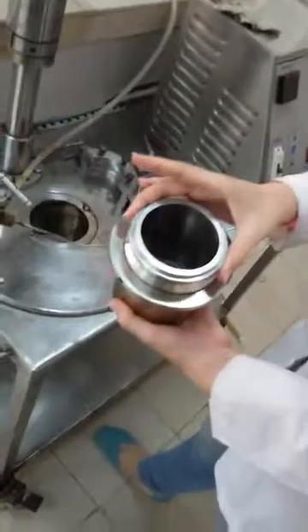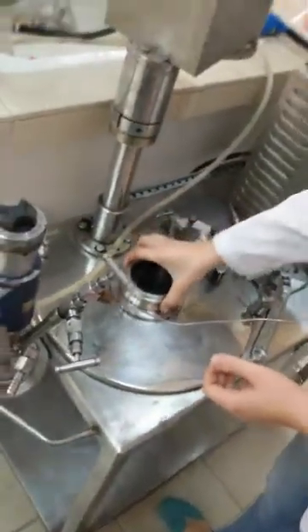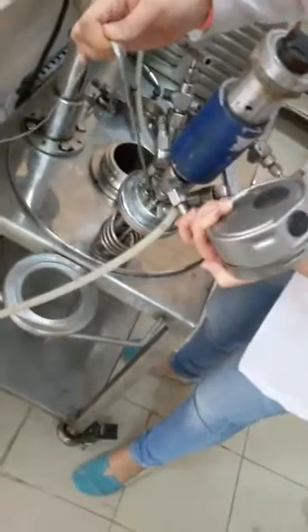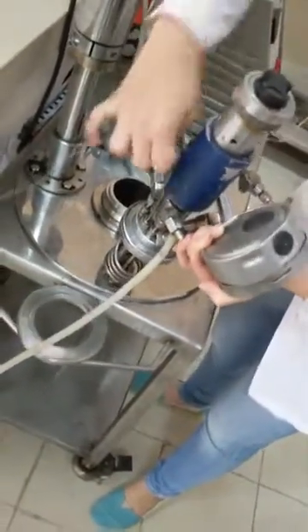I have here the vessel. I put my reactants right here. I also have the reactor tube here, which holds the sensor — the sensor which measures the temperature inside the vessel. This is the sensor.